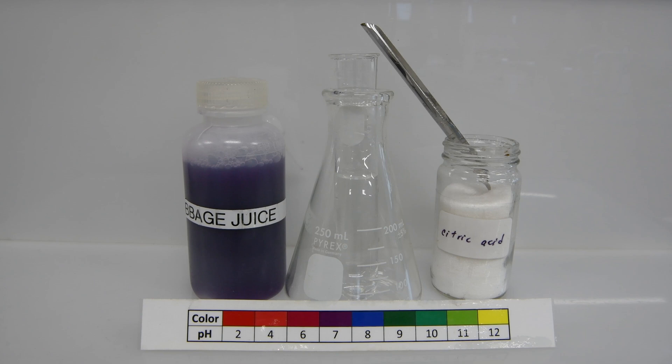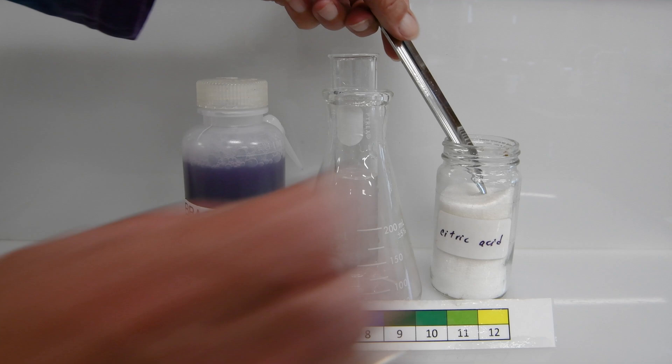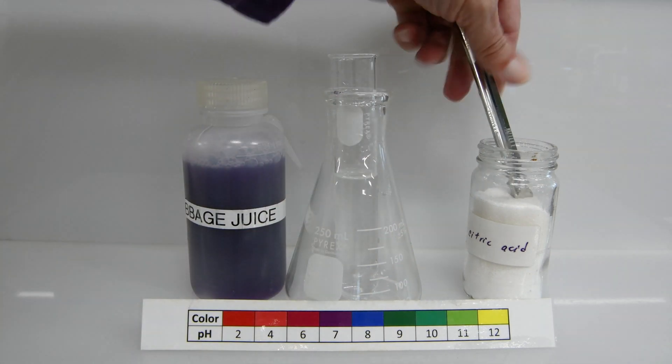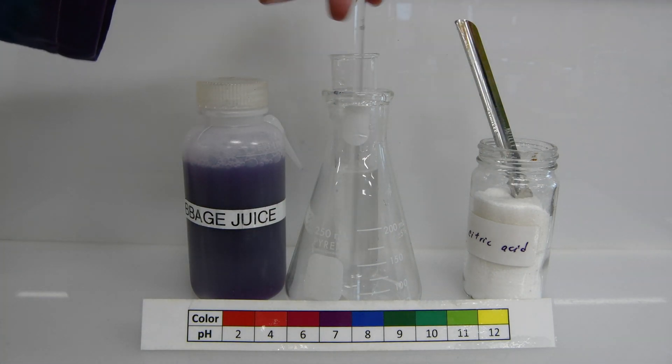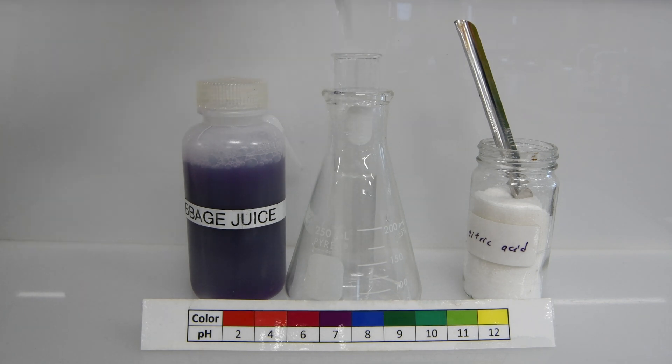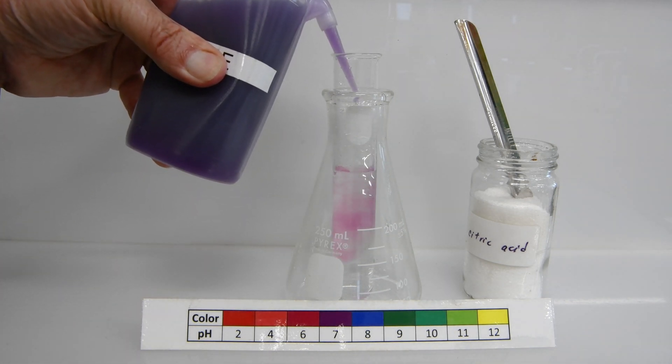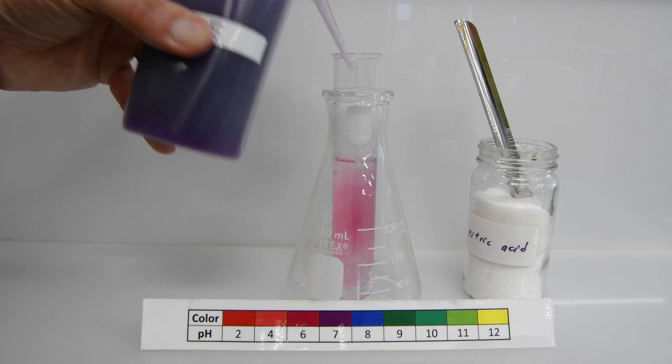I used to use vitamin C, ascorbic acid, in the experiment. But we've switched that to citric acid. They're very similar compounds. And we just happen to have plenty of citric acid around. So let's go ahead and add a small sample. And we'll get that stirred around to dissolve it. And now add our cabbage juice. And it's forming a very lovely red color.